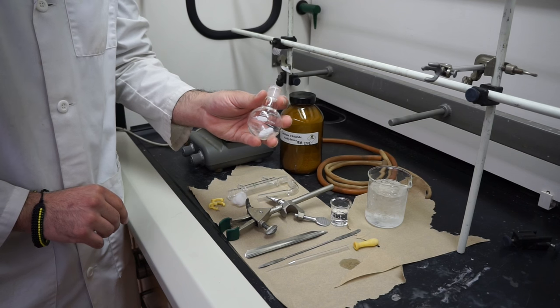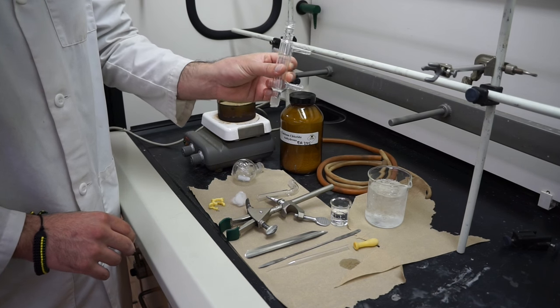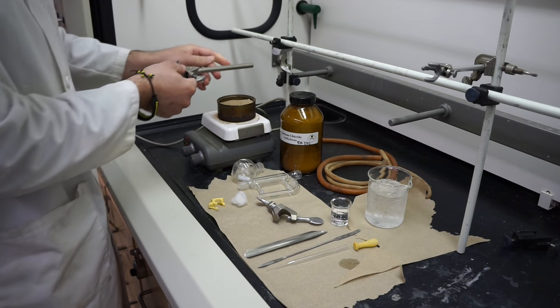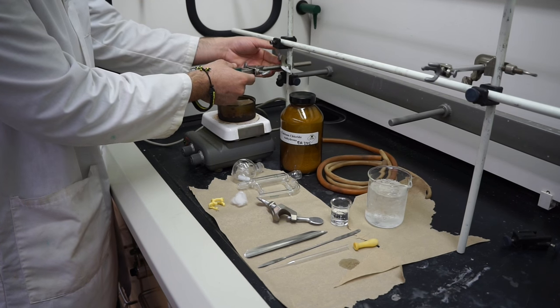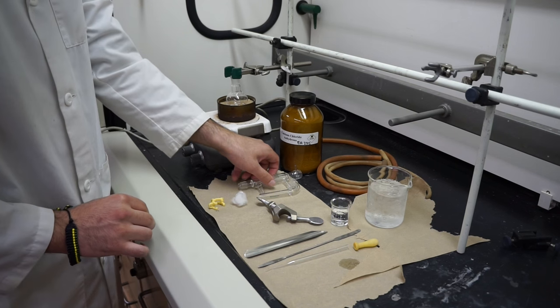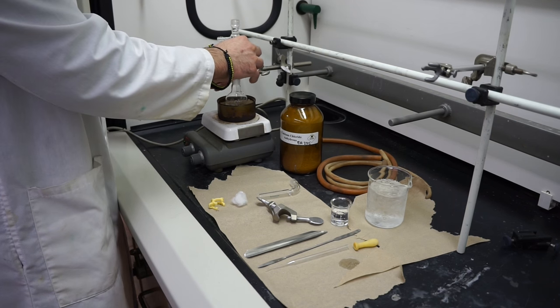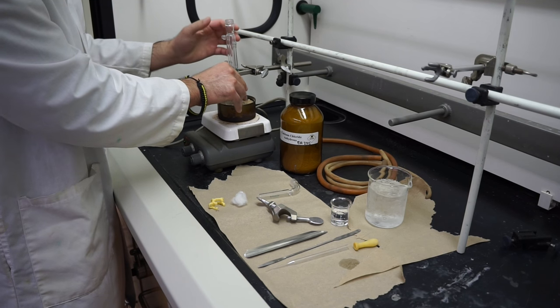So there's absolutely no water on the surface of your round bottom flask. You'll get your round bottom flask as well as your water-cooled condenser, and you'll attach them using an extension clamp. We're going to set up the extension clamp and make sure we have it at the height that we want. We'll put the round bottom flask into the sand bath with no heat, and then we'll take our water-cooled condenser and put it over the top. We'll tighten that up and make sure there's no possible way they break apart.